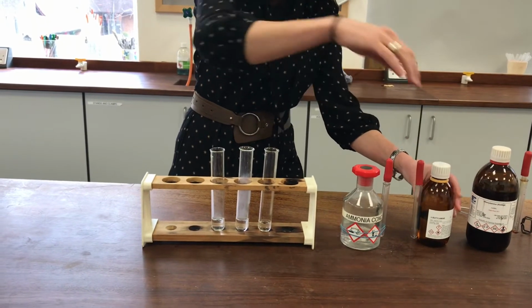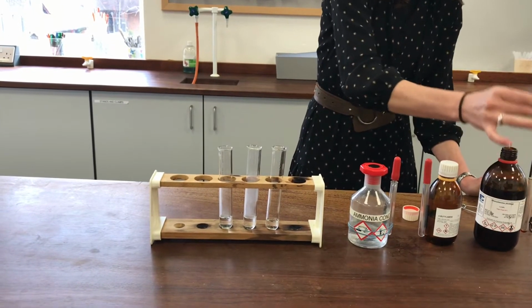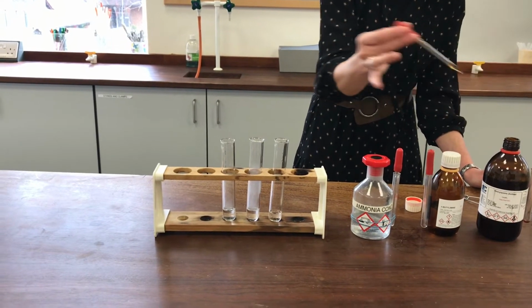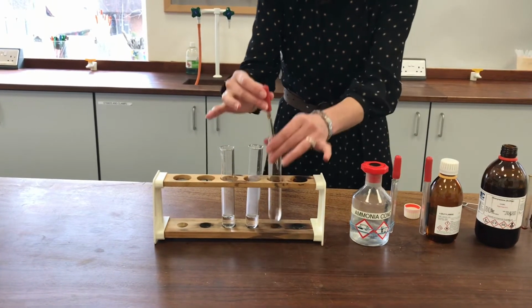And finally, the phenylamine. Now this one was extremely difficult to get it to dissolve before. I had to heat it up quite well, and even then it made an emulsion. It looked very cloudy. So let's see how this one compares. You can see the real yellow colour of the phenylamine here as well. I'll drop it into the hydrochloric acid.